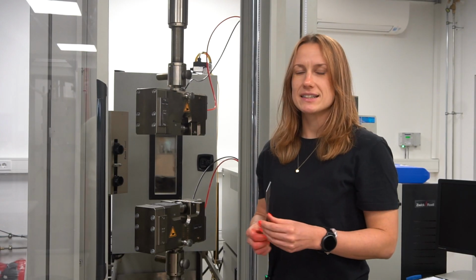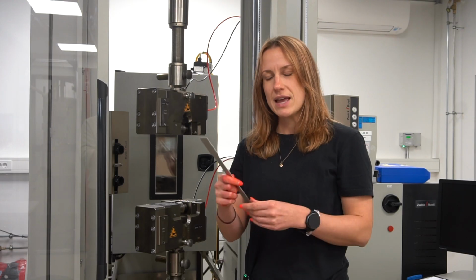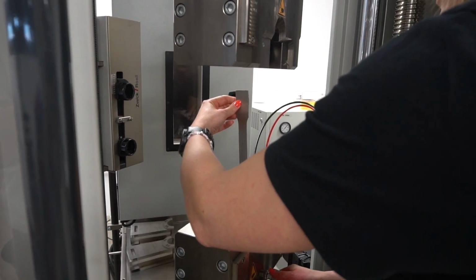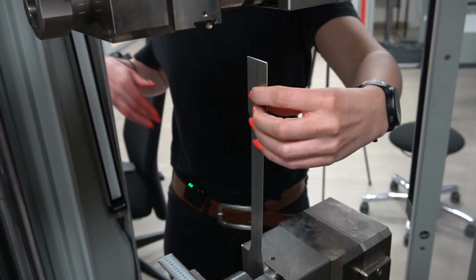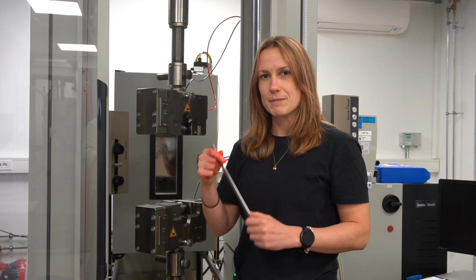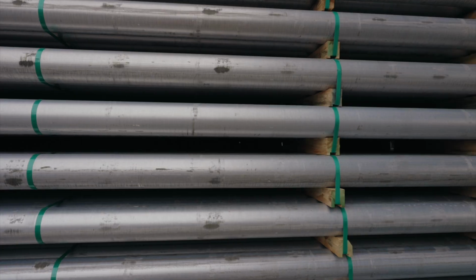So once we've selected interesting alloys from the material properties and the microstructural characterization we just showed you, we go on for mechanical testing. So this one would be a tensile sample, easily explained. It goes into the machine, and then one of the stems pulls on one end, and at some specific strength and some specific elongation, the material ruptures. And these mechanical properties are very relevant for industrial applications, because you need to know how much energy the material can take in deformation, really, before it fails.